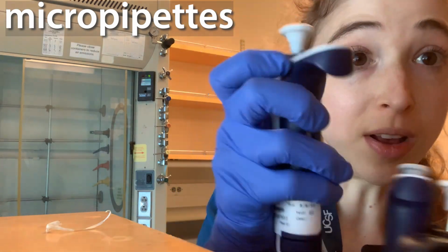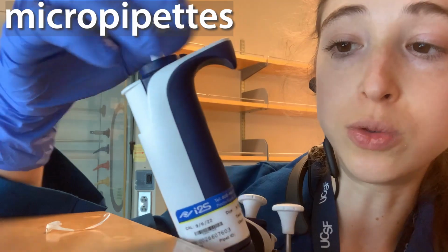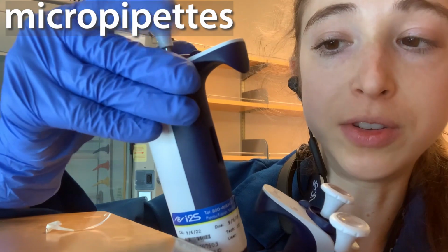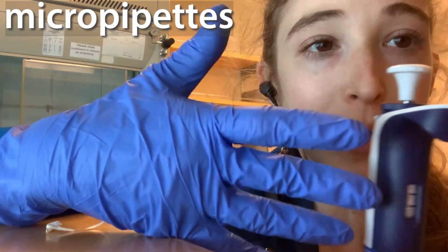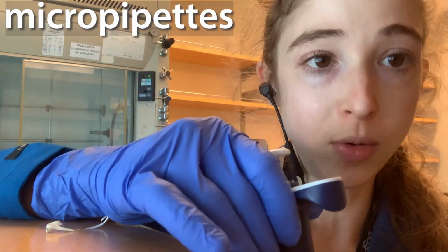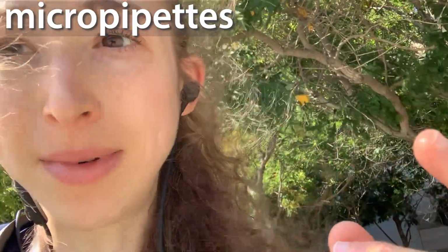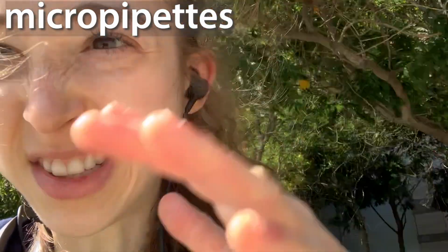And if I were to go to a P1000, well, now I can't go anywhere after the decimal point unless I'm below 1,000. So you can see if I go to 1, then the 1 is before, and then you have 2 after, but you can't go after, so all you can do is go below, and so you're always going to be working below that decimal point, if you're working in microliters, because that would be in terms of milliliters. That would be 1 milliliter if you were above that decimal point. Basically, that decimal there is in terms of milliliters. So you can't go above 1 milliliter with one of those. So when you're at 1, the 1 is going to be before the decimal, and then the zeros are after the decimal.